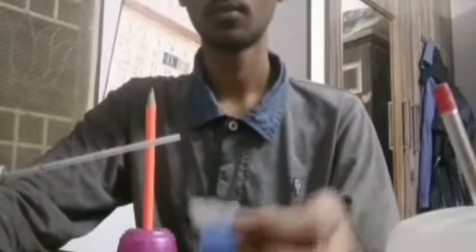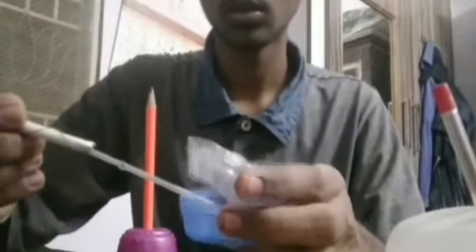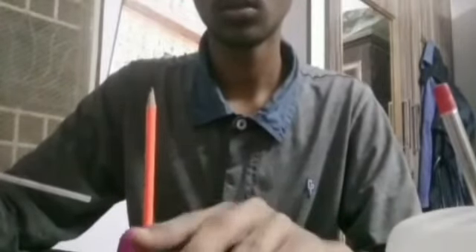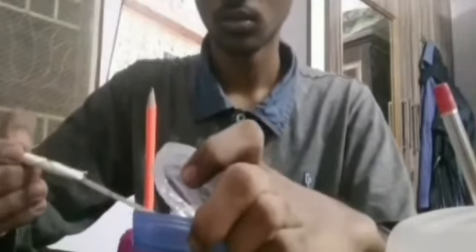So now let's take a petri dish, and you have to open the lid, not completely but partially, because you need the least microbial attack. So partially open, do it immediately. You need to take the inoculating loop and streak it inside the plate, and immediately close it. Then you have to go back to the Bunsen burner again. You need to burn the inoculating loop, the entire region, slowly. This is re-sterilization of the loop, so that you get a perfect aseptic technique. Again go back to the petri dish and do the same procedure.